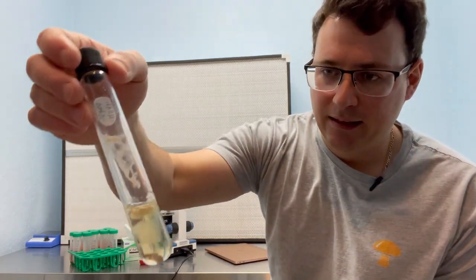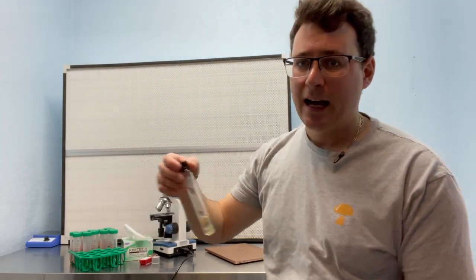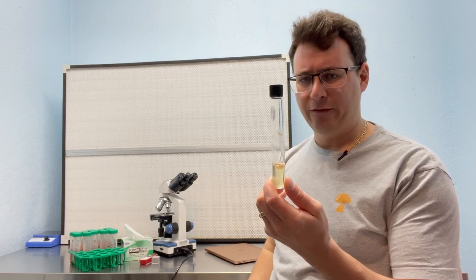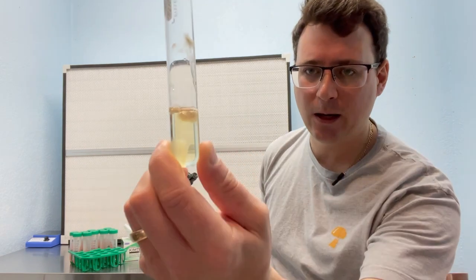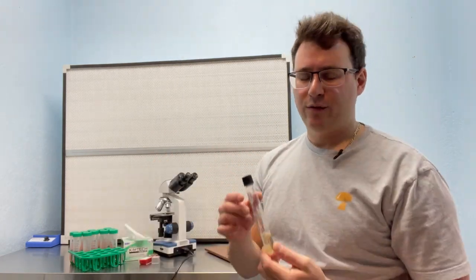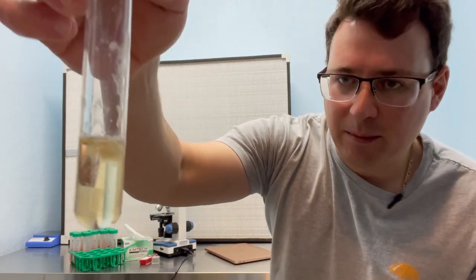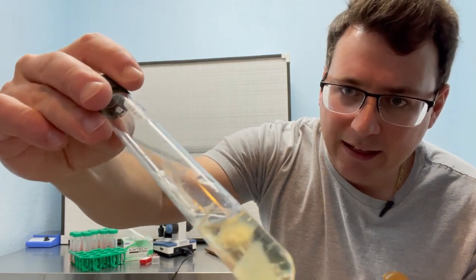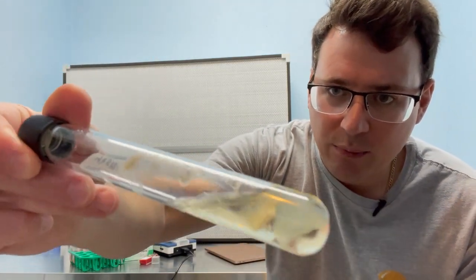However, in order to save time and save some headaches, I like to scan my liquid cultures before moving forward. So this is a pioppino mushroom that was freeze dried, and I added about 5 cc's of honey water, and then it ended up growing out pretty well.